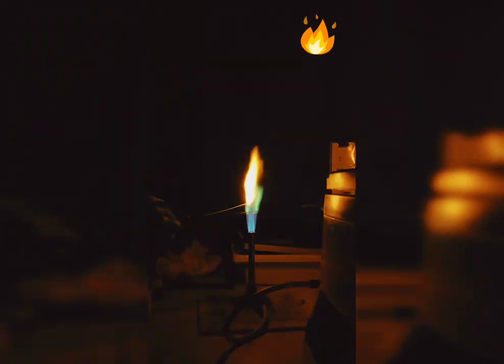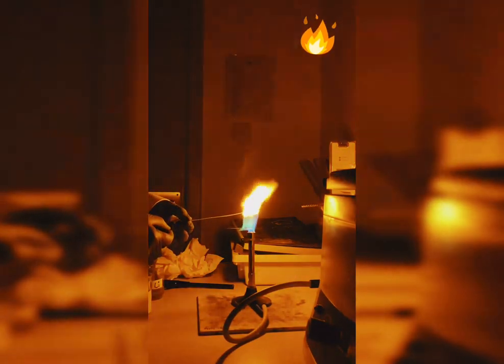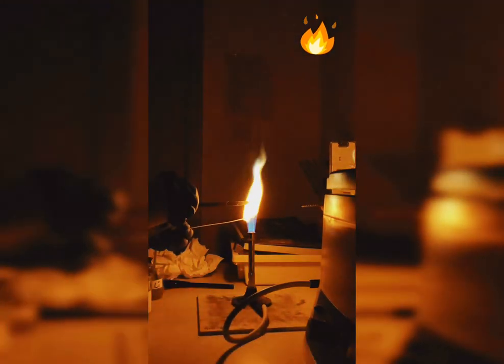If we want a mixture of different colors, we can use a bit of orange from sodium chloride, join it with copper and have a flame such as this. We can also have a mixture of a stronger red from the crimson of lithium with the copper, and have it in this way. So these could be the two colors we can also create.